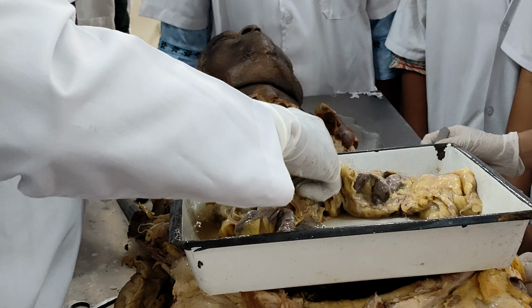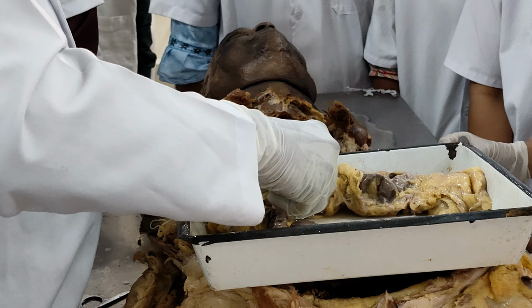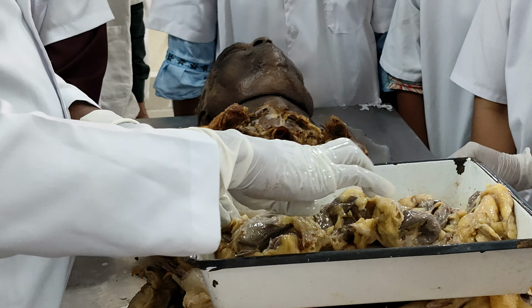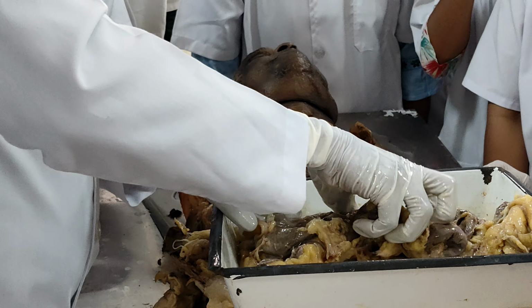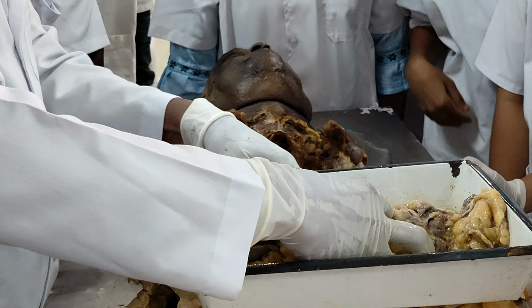So now I am keeping it in adequate position. I am removing a little bit of fat. Now if I keep it in adequate position, I can see a nice line here, one line. And just if I am lifting here also, yes, see, I can see a second line.